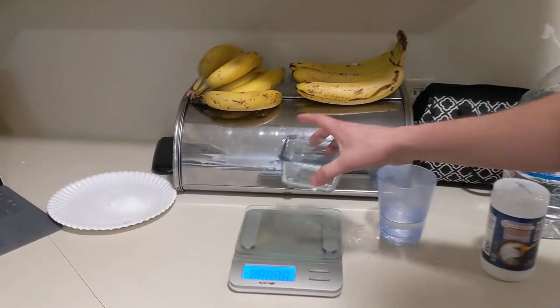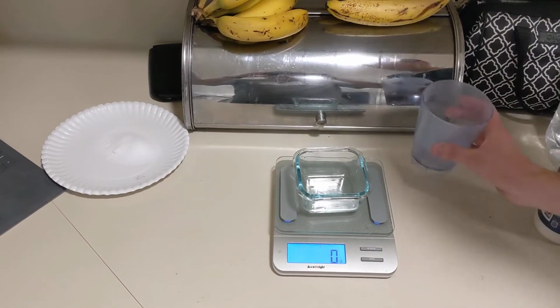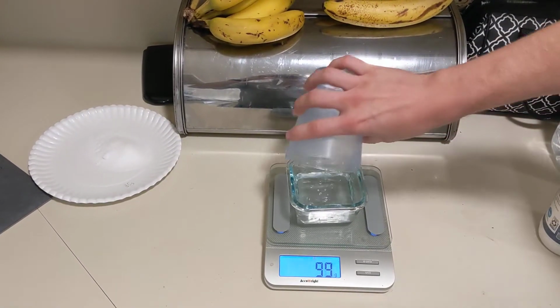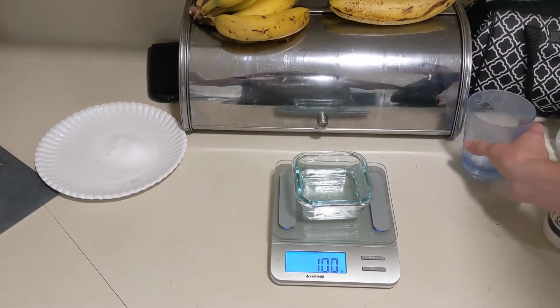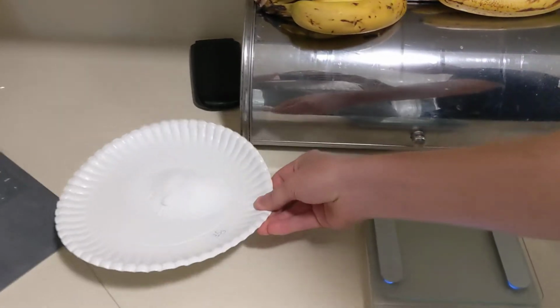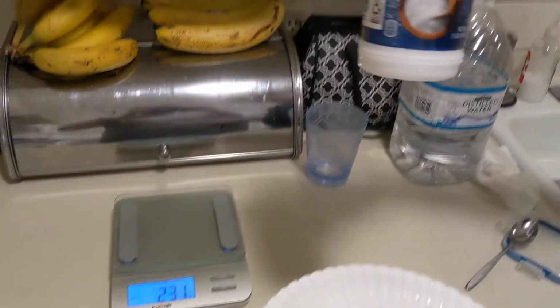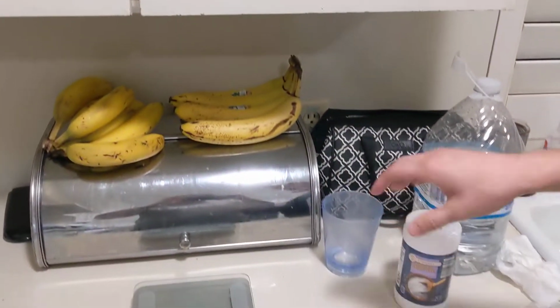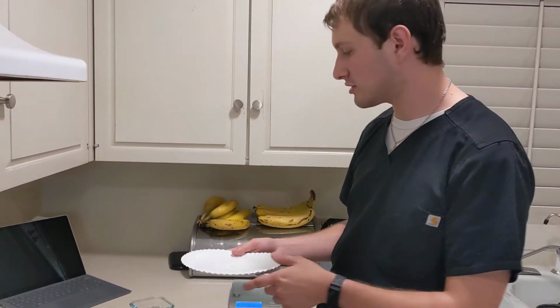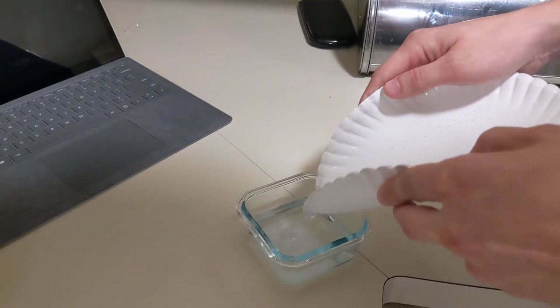you the numbers just so that you know I'm not cheating on anything. So I'll clear that out. It's 0 grams, filled up with 100 milliliters, or just about, 100 milliliters of water. And then right here, I can't rebalance it out, but I pre-measured out 35 grams of table salt, it is iodized, which could possibly affect the results, but I've already done it before and it all worked out pretty much the same. So put that all into the water.